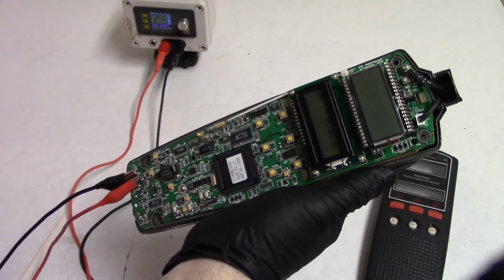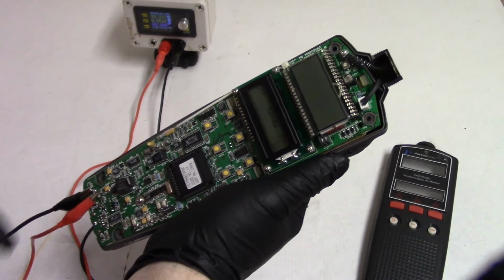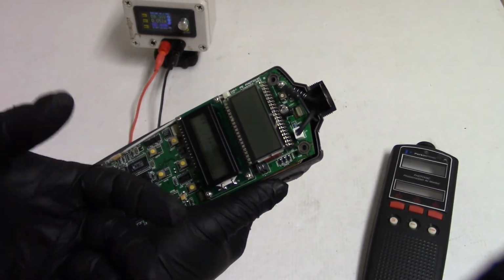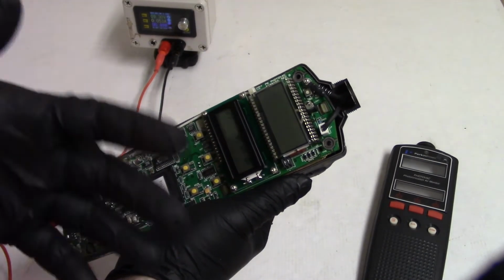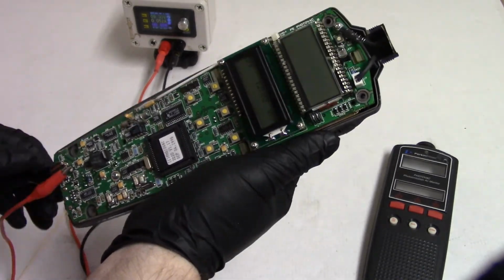Say I want to weld or cut an empty propane tank. I could have a little tube coming off the end, stick it inside the tank, run this, and see what it comes up with. It'll tell me how much propane's in there, fumes and whatnot. So that's kind of handy.